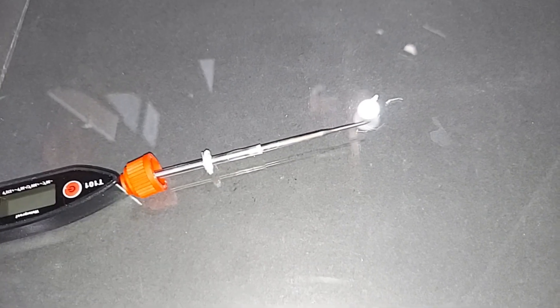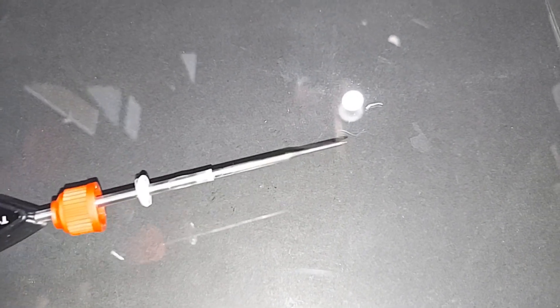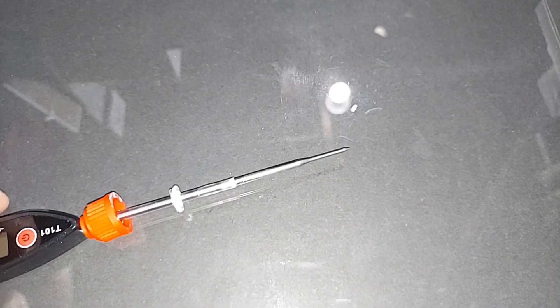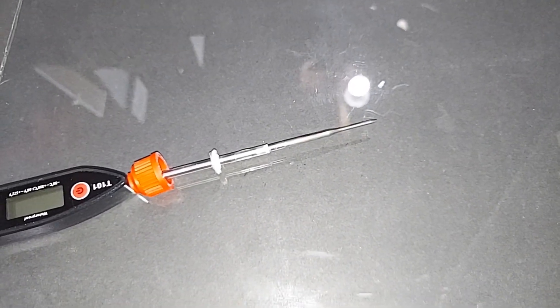One last thing — I just wanted to show the thermometer tip that was inside the flask. It's in perfect condition. You can't really tell through the camera, but it is. This thermometer in particular survives really well.